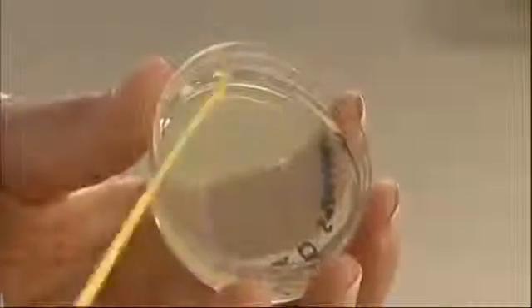Finally, give the plate one last quarter turn and draw another ten lines. The aim of this is to obtain single colonies of bacteria.